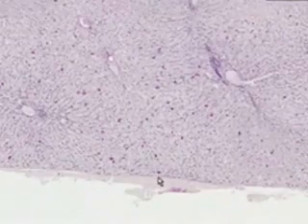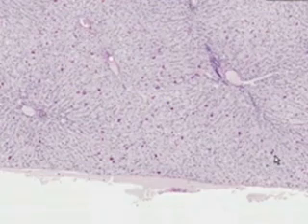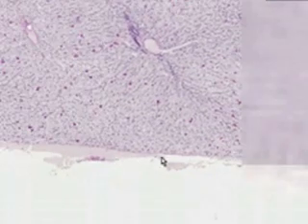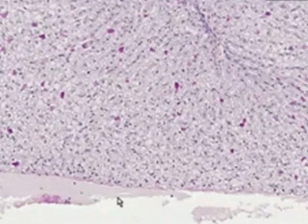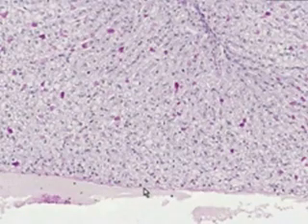you right now. Well, first of all, no surprise, this little bit of fibrous connective tissue at the edge is probably the true capsule of the liver. And like every capsule, it's mostly fibrous tissue. And because the liver is intraperitoneal, if you saw a few mesothelial cells on the very surface of this connective tissue, like perhaps, maybe here, for example, then you can guess that this was the capsule of the liver, which is also the visceral peritoneum of the liver.